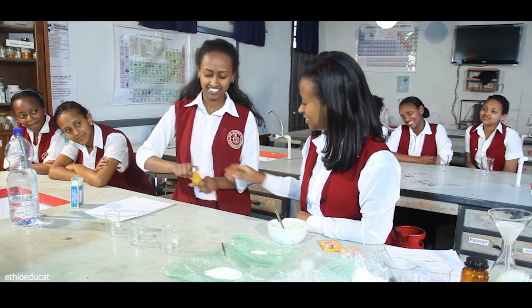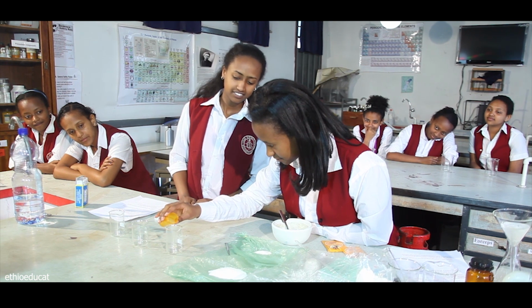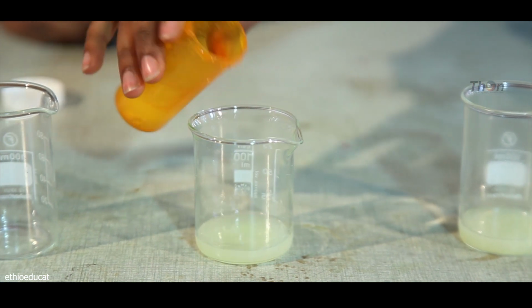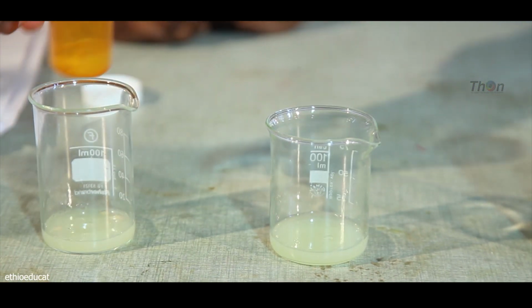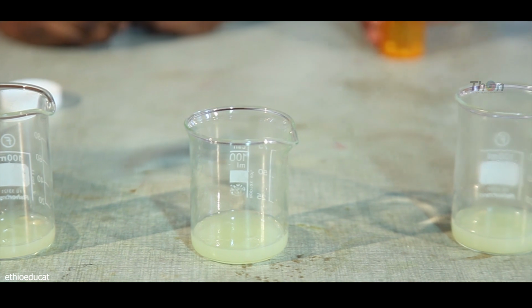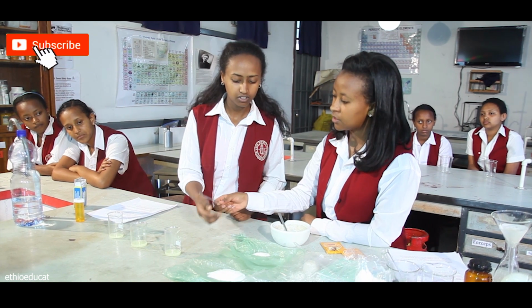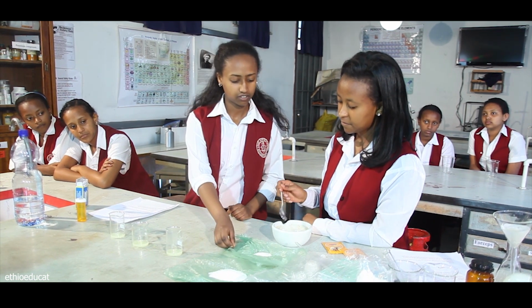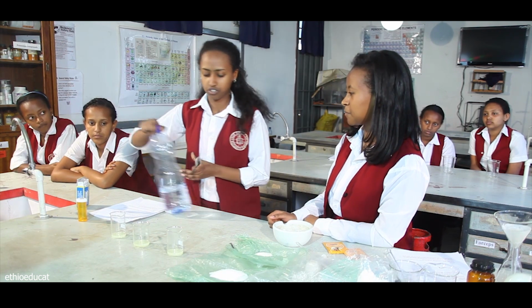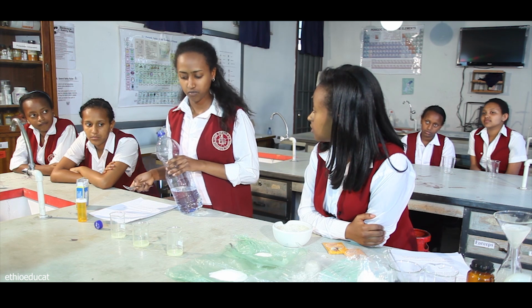How do you open this? I think enough for you. Shall we add more? Yes, and the middle one. Yes. Okay, that's all. So why did you add the water? Okay, before that, let's take out the seed. Can I have a spoon? I don't think it can help me. I think we need this to add sugar in, so we need to wash the spoon. Now maybe you can use a spatula. Okay, let's try.